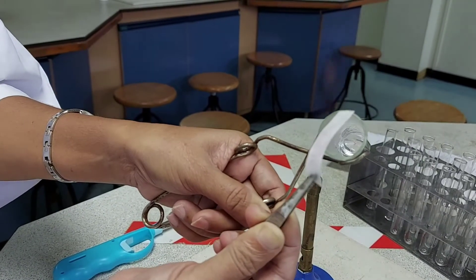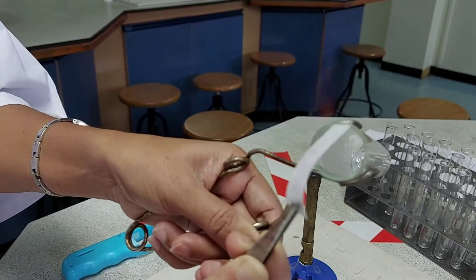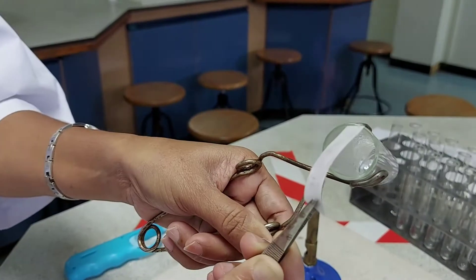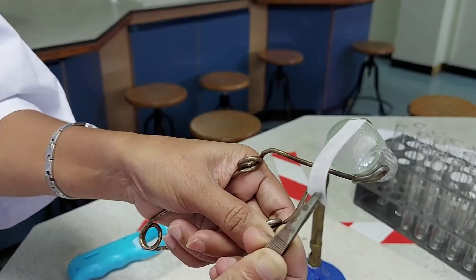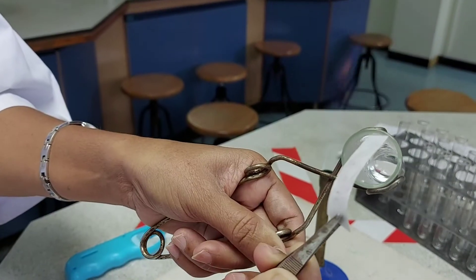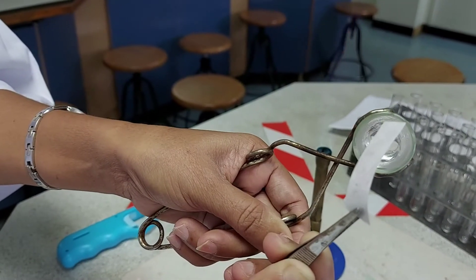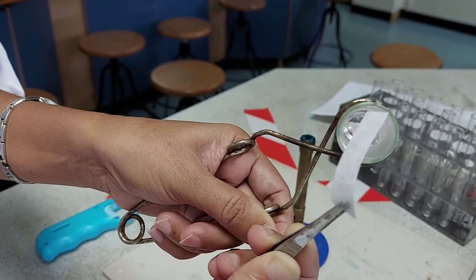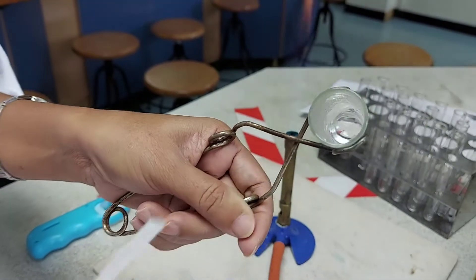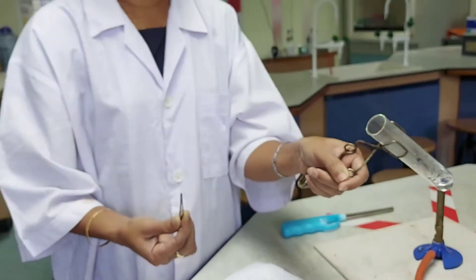This is a clear test for the sulphite ion. The gas evolved is sulphur dioxide — it has a pungent smell and it decolourises the filter paper soaked in potassium permanganate solution. So the given solution contains sulphite ions.